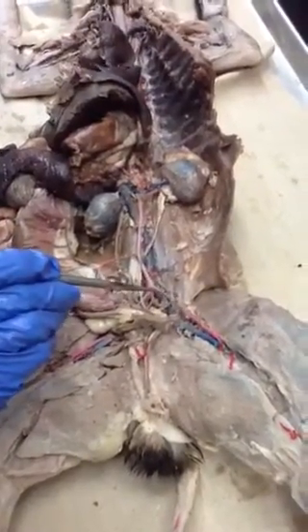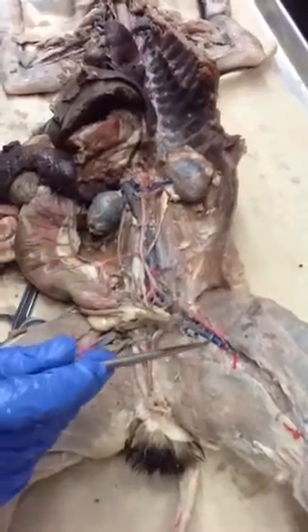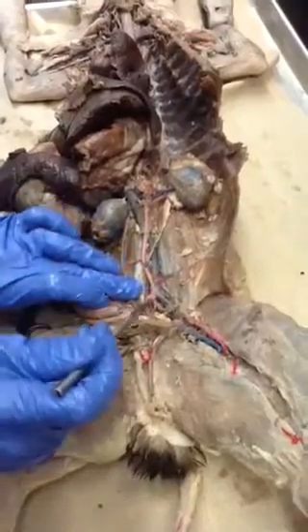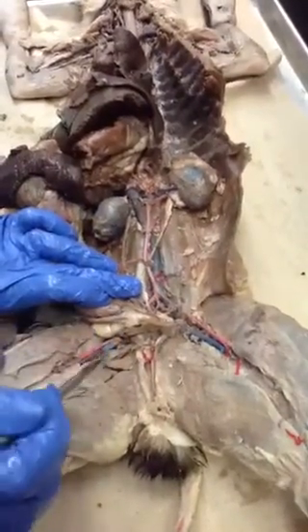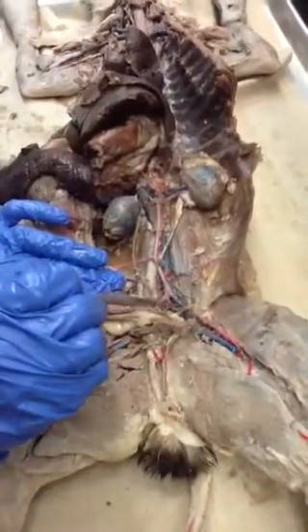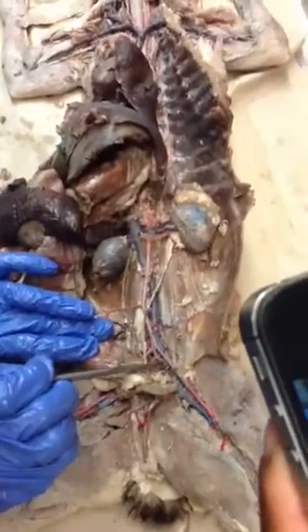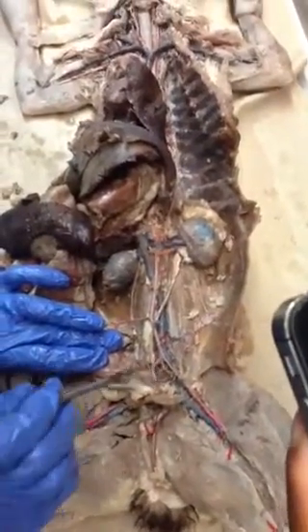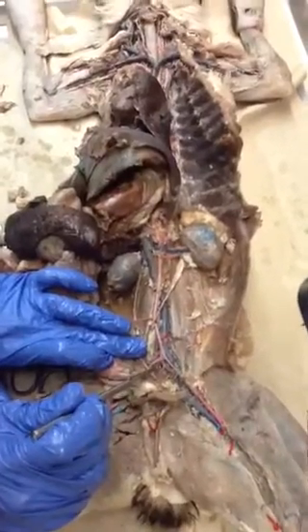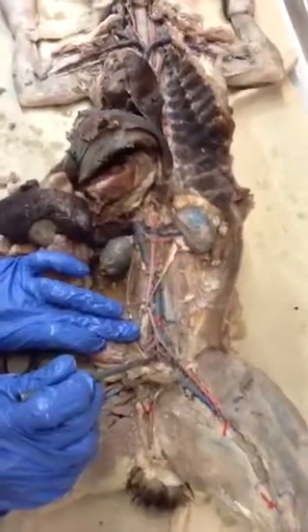If we follow the branches, we've got left external iliac artery which becomes the left femoral artery. On the right side, we've got the right external iliac artery which becomes the right femoral artery. And then really down deep here, we've got the left internal iliac artery. Same thing over here — right external iliac artery, right internal iliac artery.